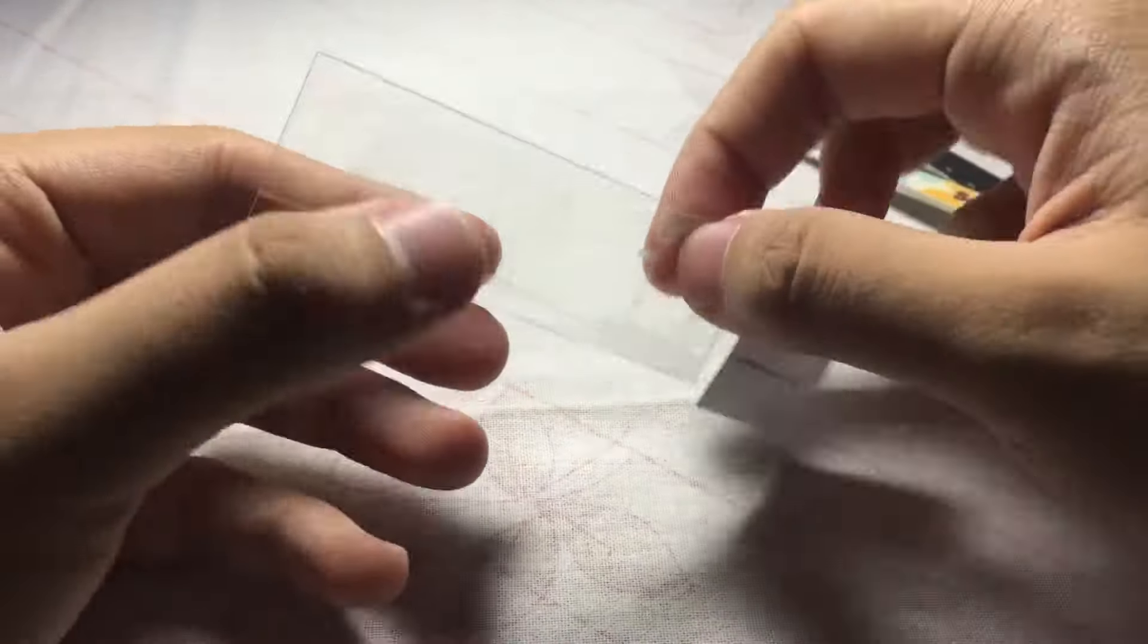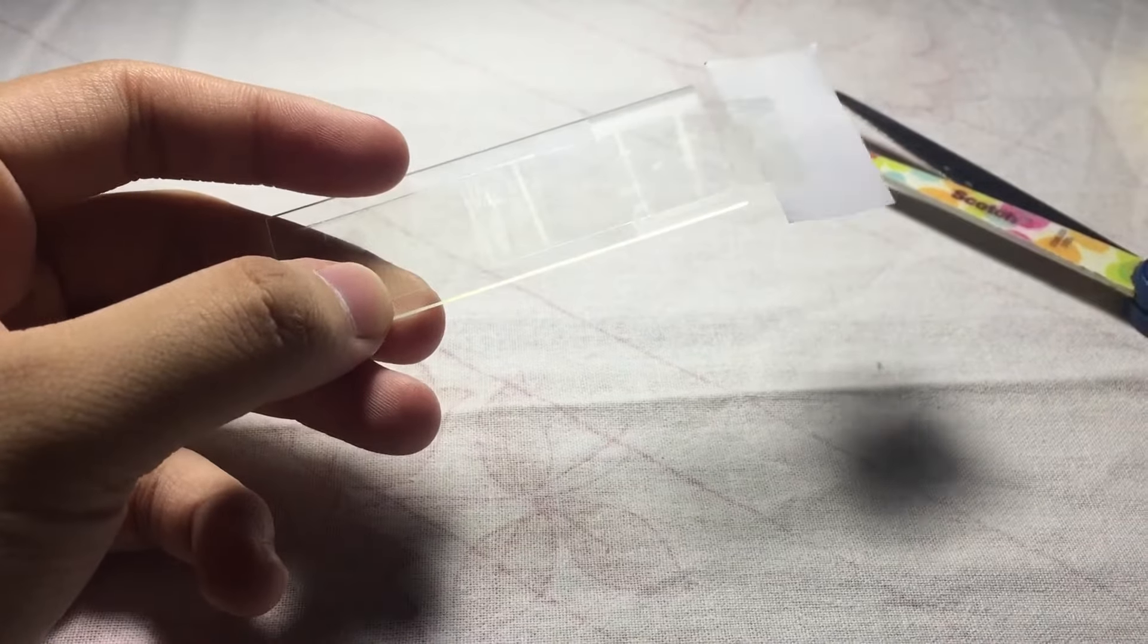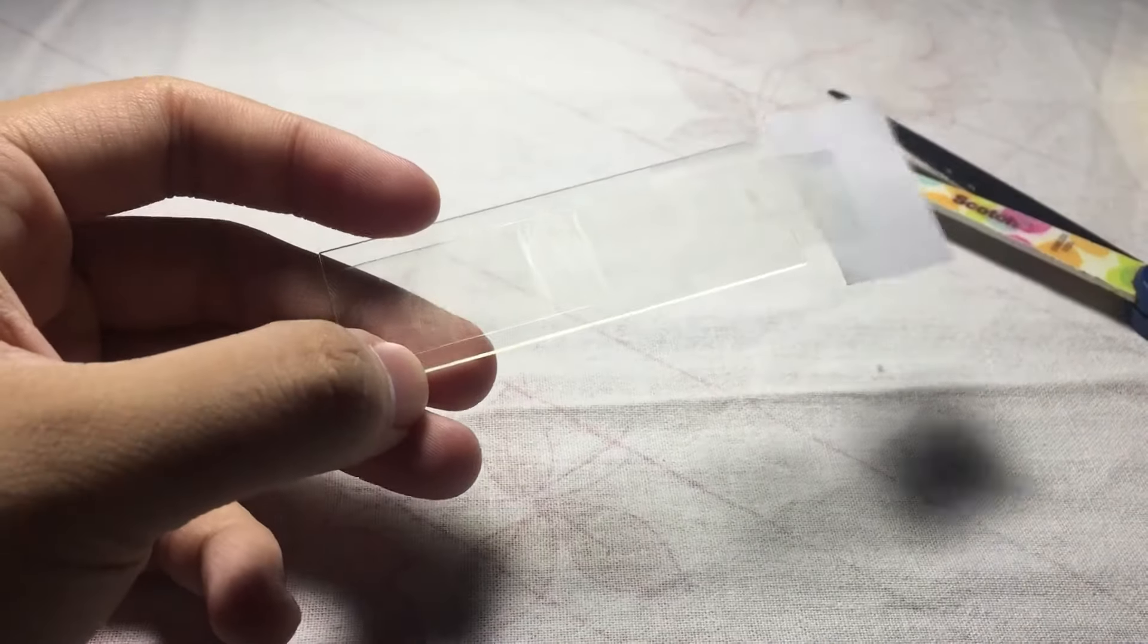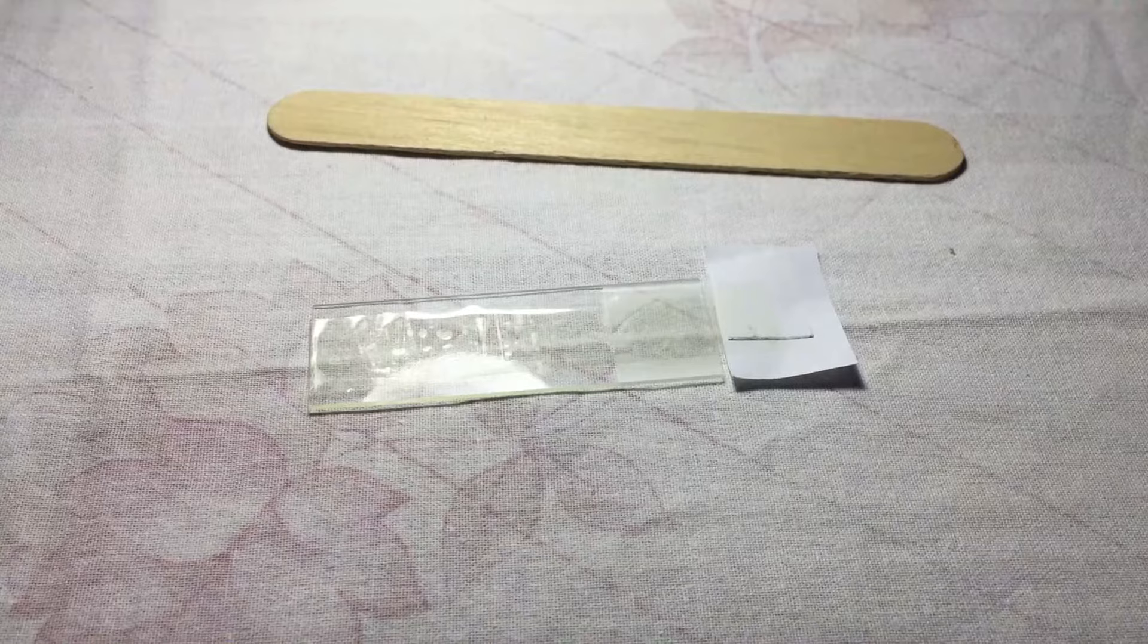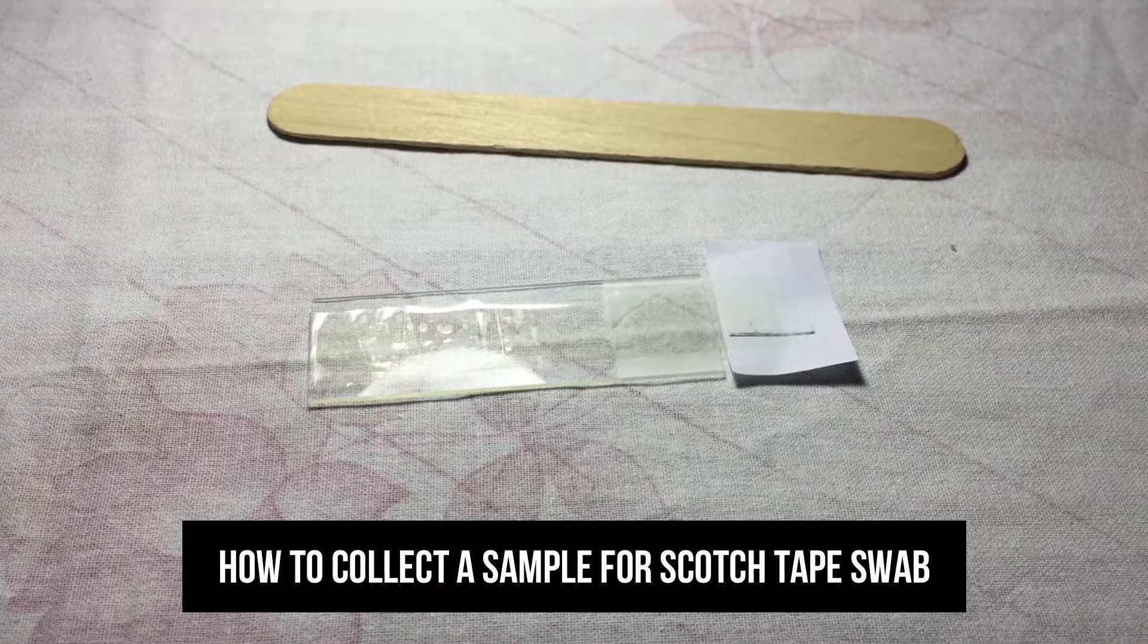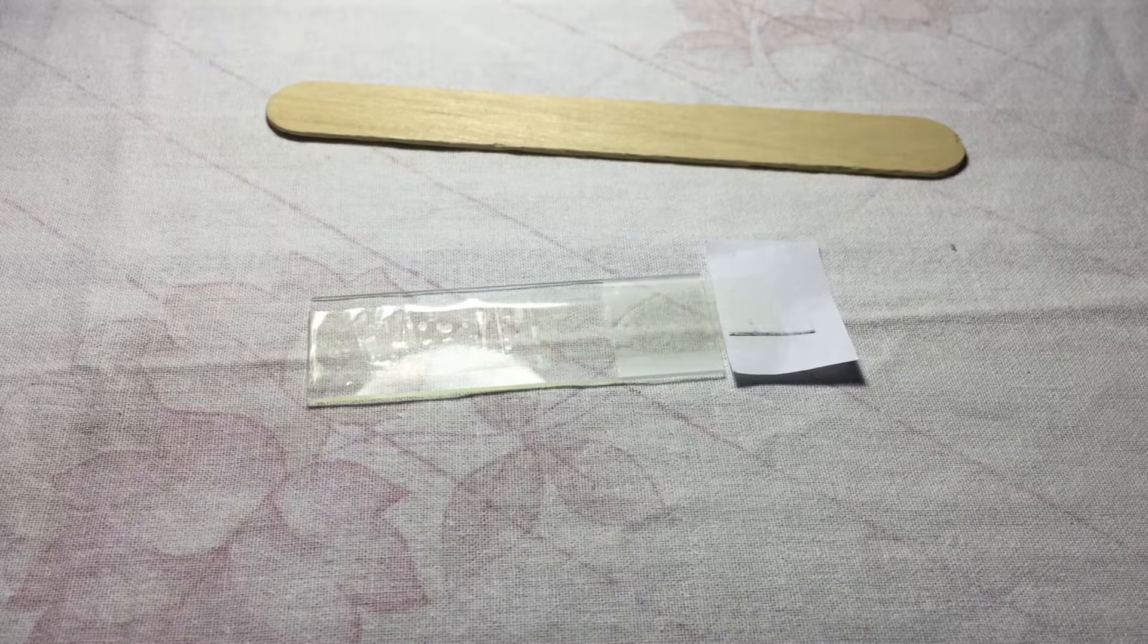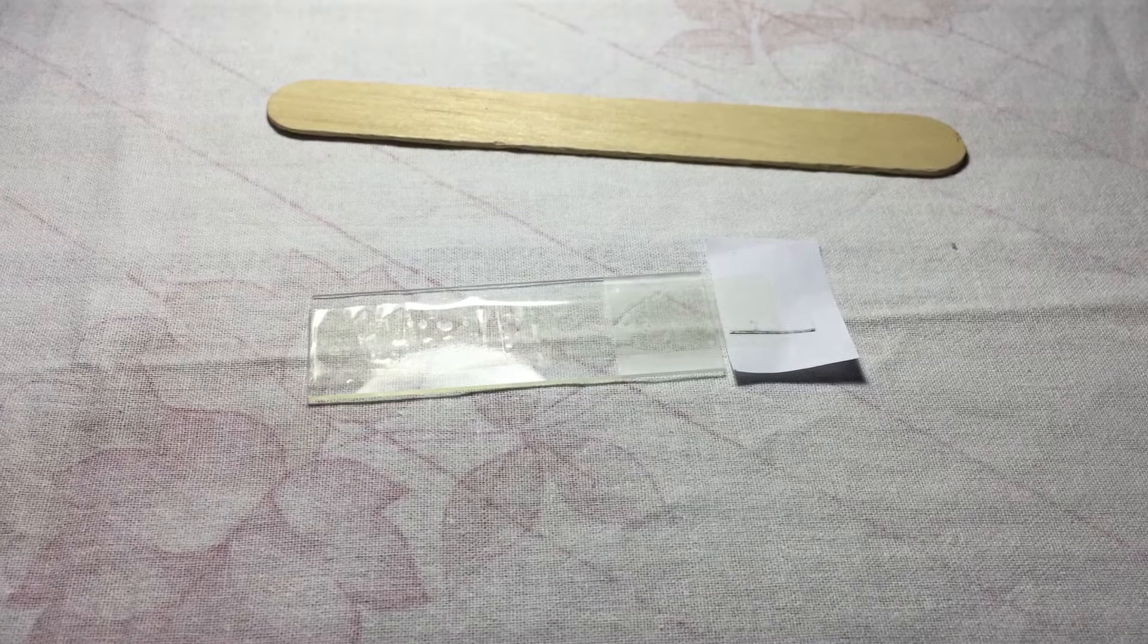Now we go to how to collect your sample. For the next part, we'll show a demonstration on how to collect your sample. For this demonstration, I'm not using a real anus or perianal region - just imagine using my two fingers.